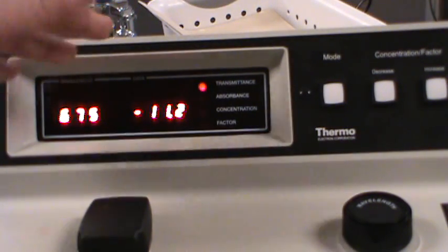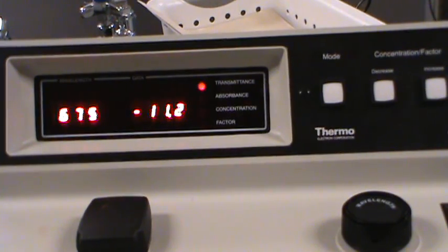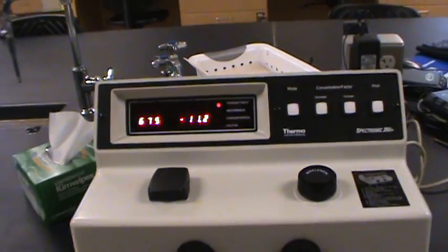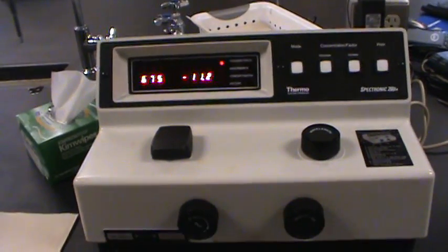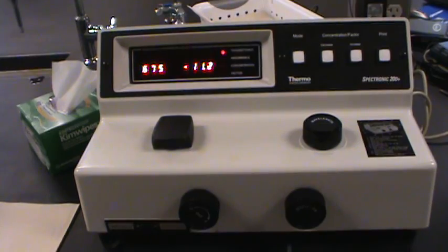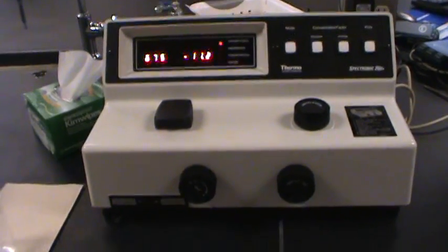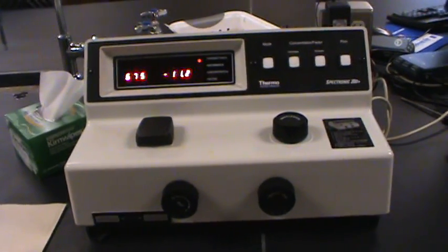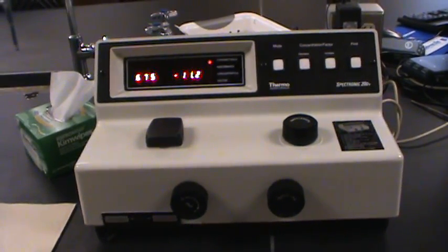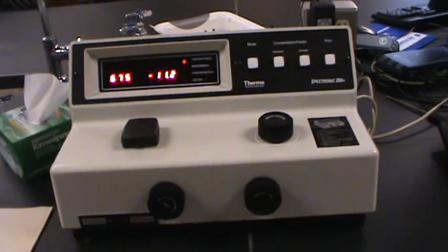Now for the important part. How do we use this? What can we do with this instrument that we can't just do with our eyes?